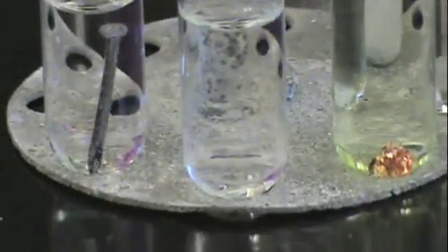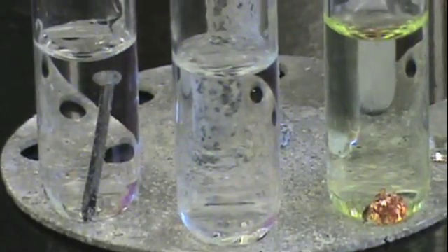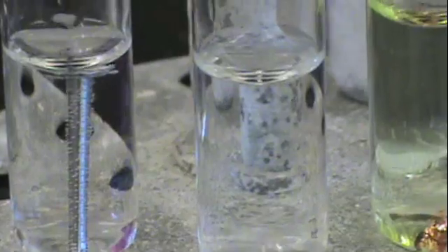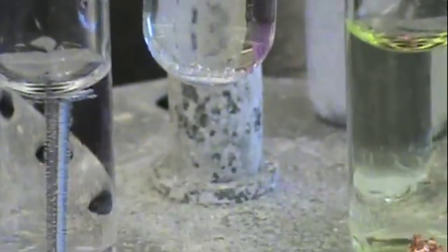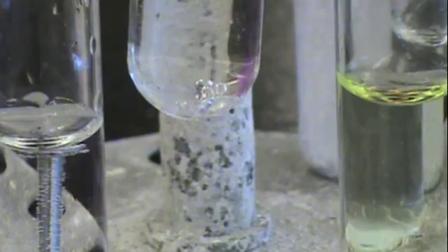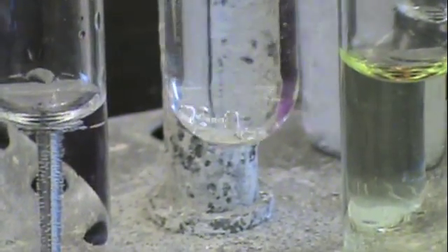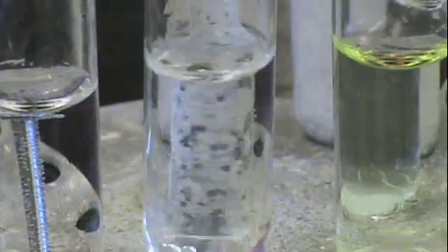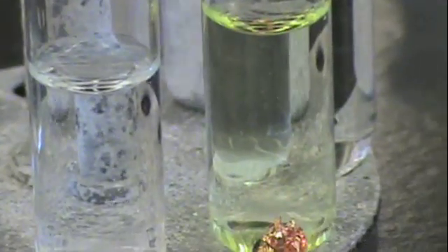If we take a look back at iron, we see that bubbles are forming on the surface of the metal, so there is a reaction. And the same thing is true of aluminum. The only metal that doesn't react with HCl is copper, meaning it's lower than hydrogen on the activity series.